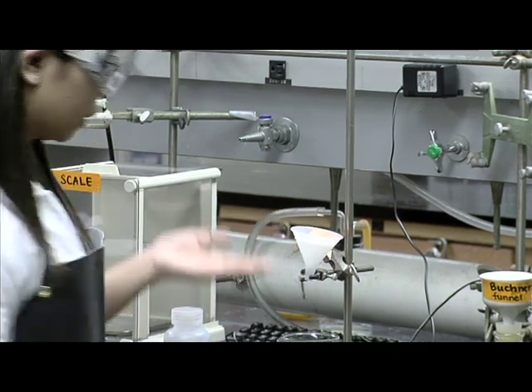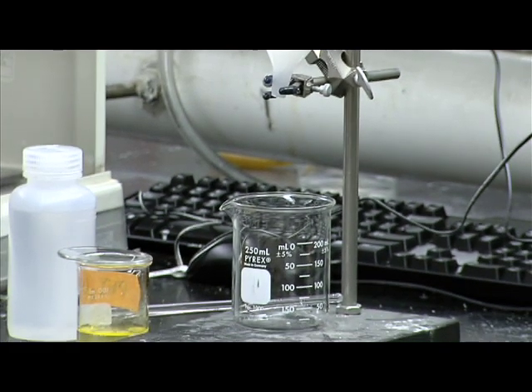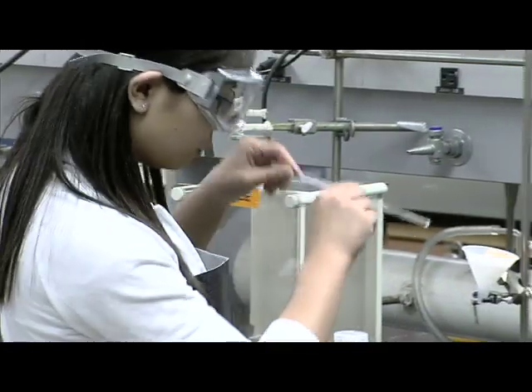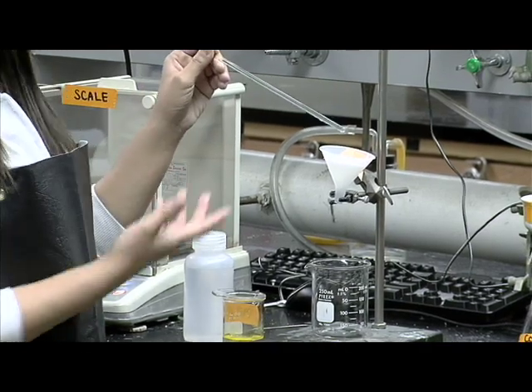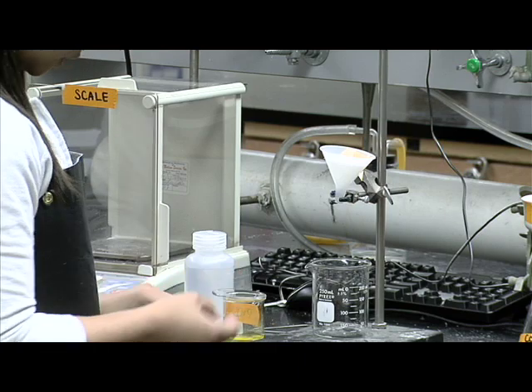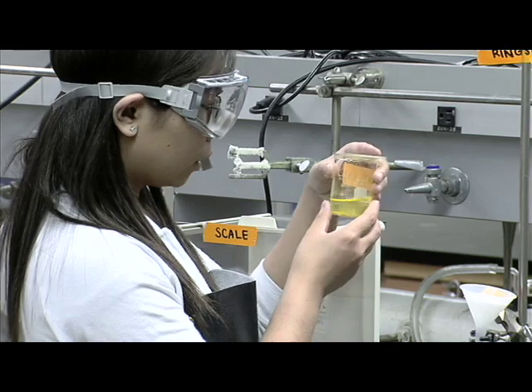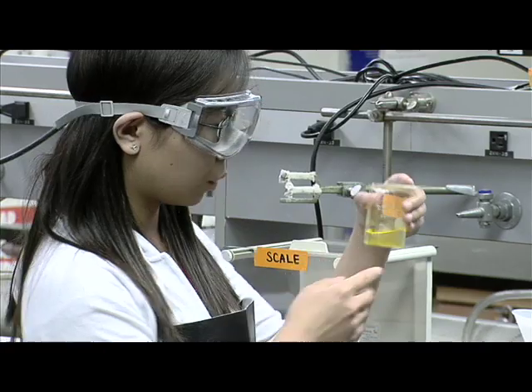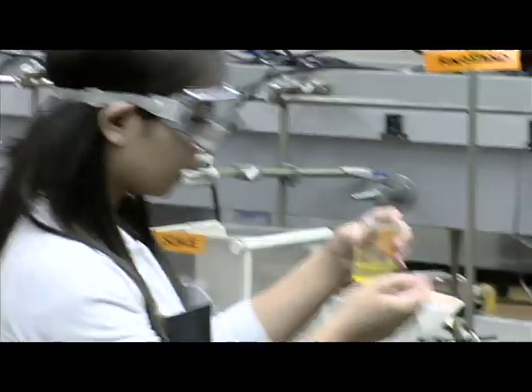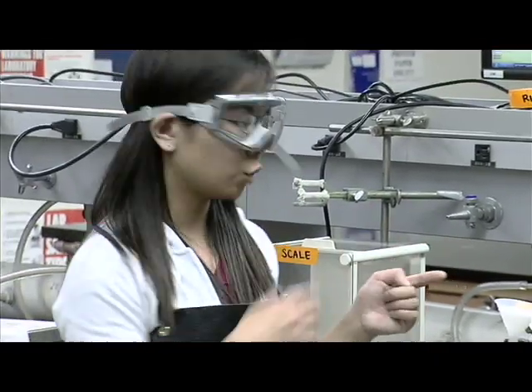The beaker below is just to collect the filtrate. To do the filtration, we're going to pour the solution along the stirring rod into the funnel. The stirring rod is here to control the flow and prevent splashing. After we're done pouring in the liquid, we're going to use the solvent to wash the solid and dump everything into the funnel. Then we're going to wait until the filter paper is dry.